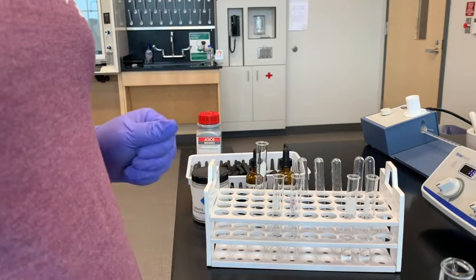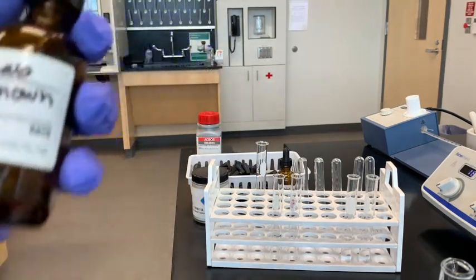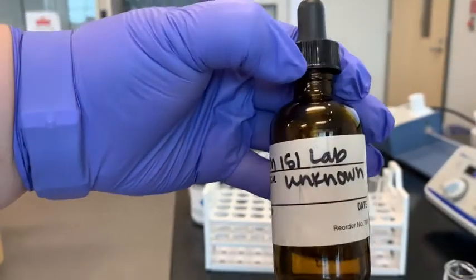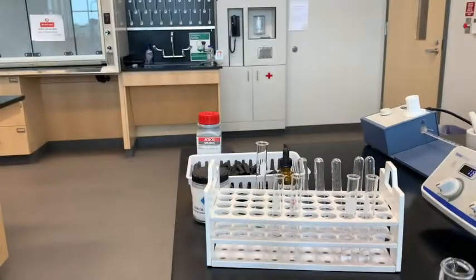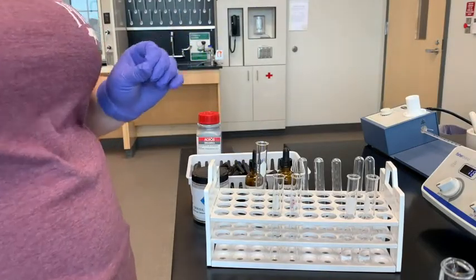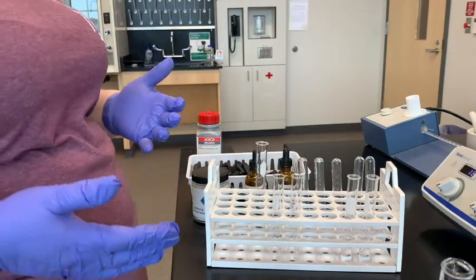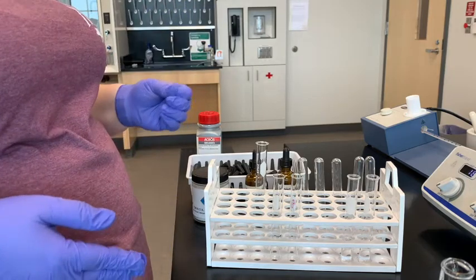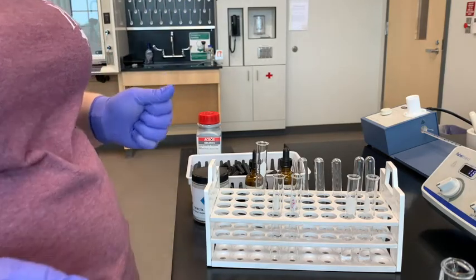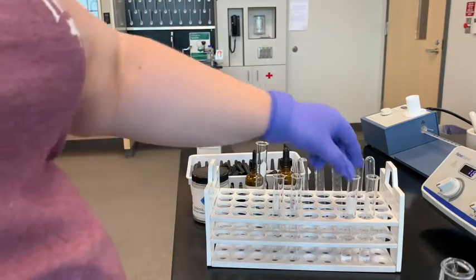You're going to find the solubility of your unknown liquid. The unknown liquid is the 151 lab unknown. You're going to identify it by three different physical properties: solubility, which we're doing first, then density, and boiling point, which will come in a few minutes.